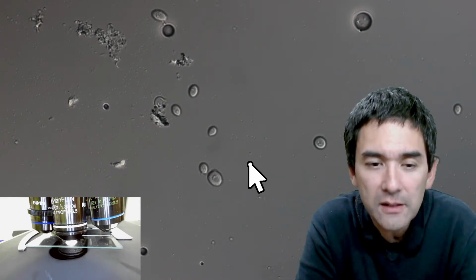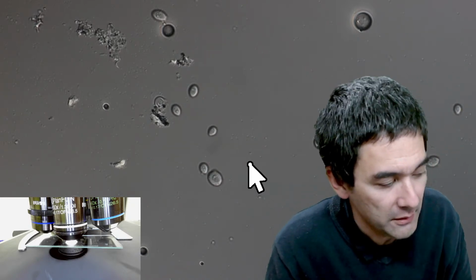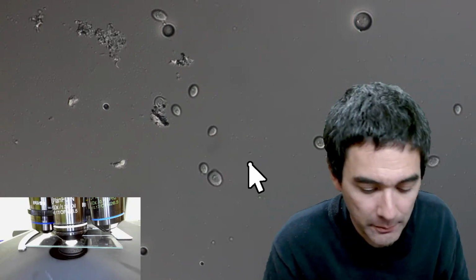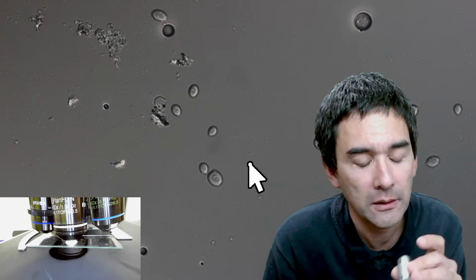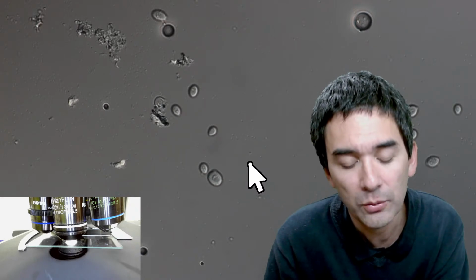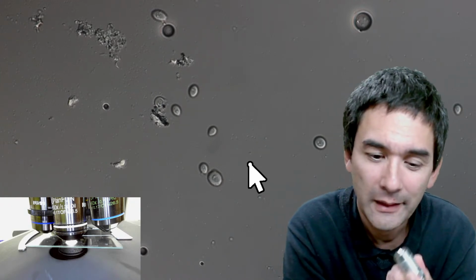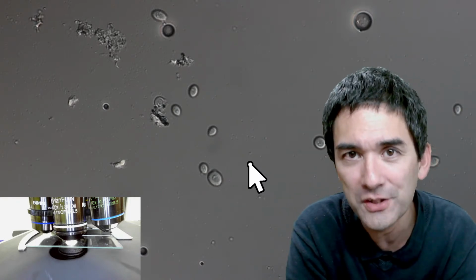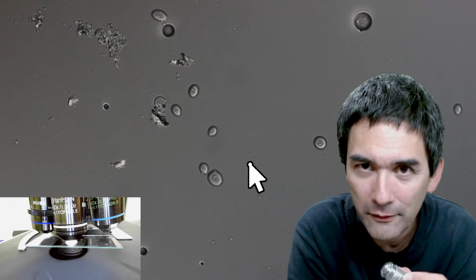Well, in any case, if you clean your objective lenses, generally the companies, at least the higher end companies, have specific recommendations on how to clean them. For the low cost objectives, I would say just use pure alcohol. That is possible, but only clean them if it is absolutely necessary. But I do have to tell you what I once did. It's even worse. I did not get immersion oil on my 40 times objective. I got some mounting medium.